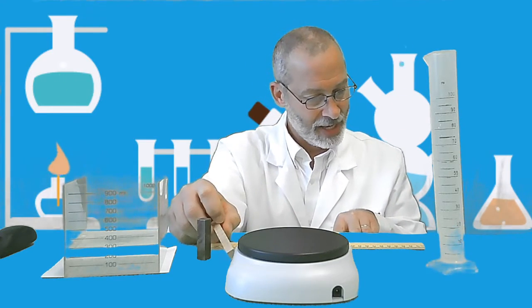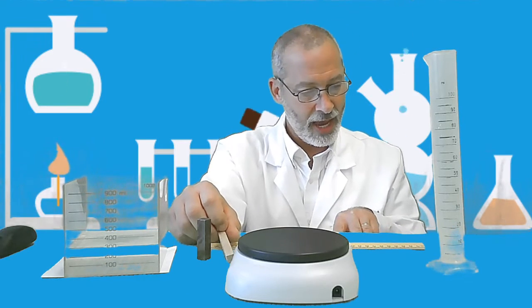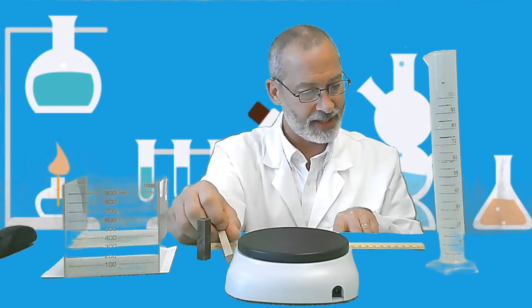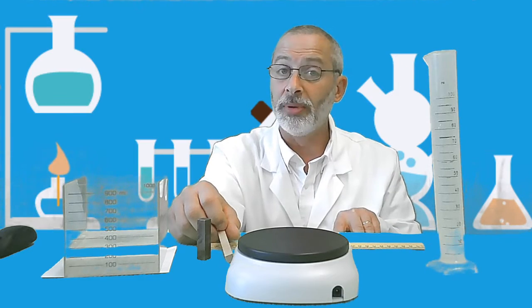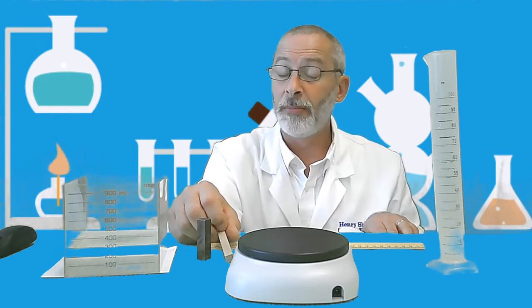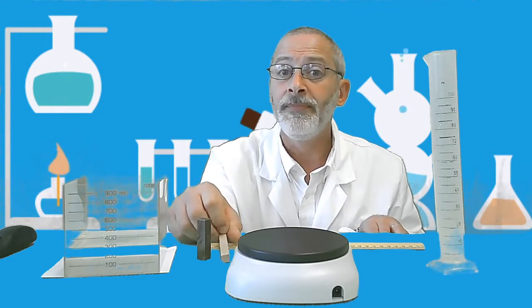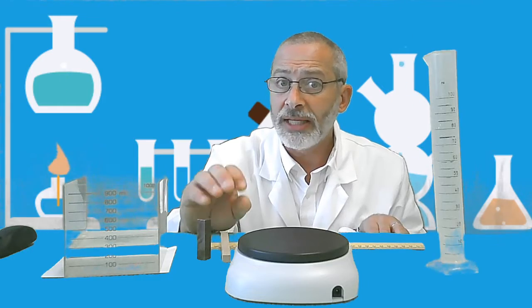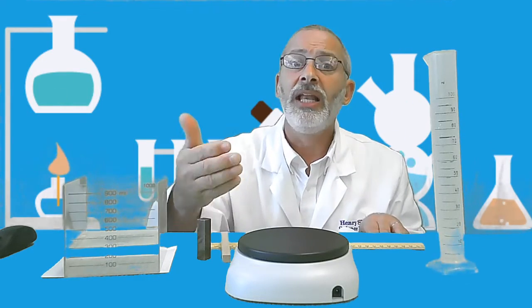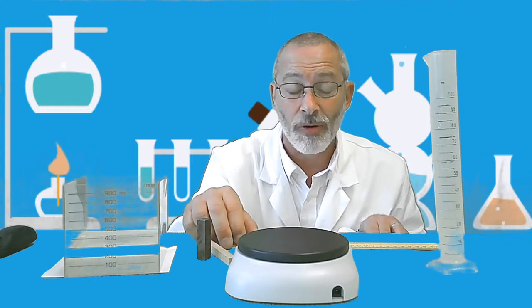Next step. Calculate the density of object A and show your work and express the density in grams per cubic centimeter. Now, it says there density down below, grams per cubic centimeter. That's the space where you're going to write it. If you can't figure it out quickly, don't figure it out yet. Let's go on to object B, and then I'll give you time to do all the calculations.